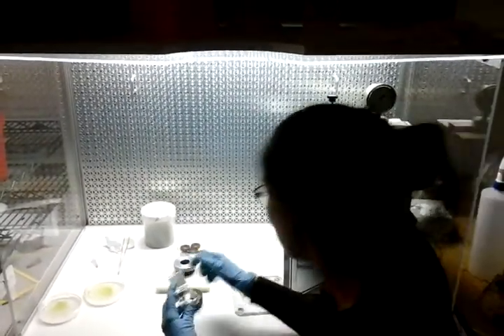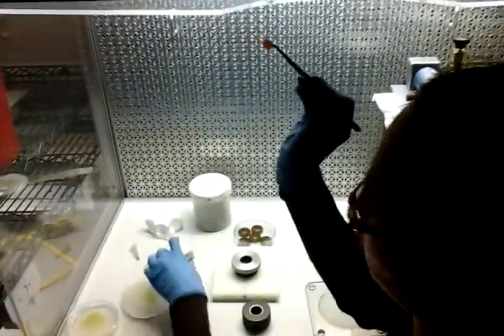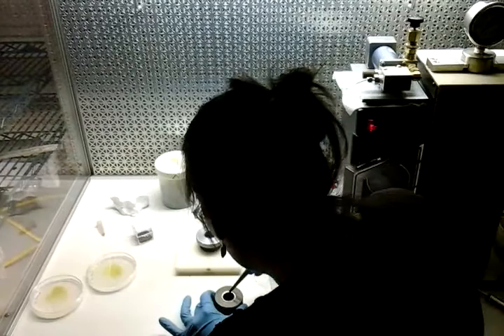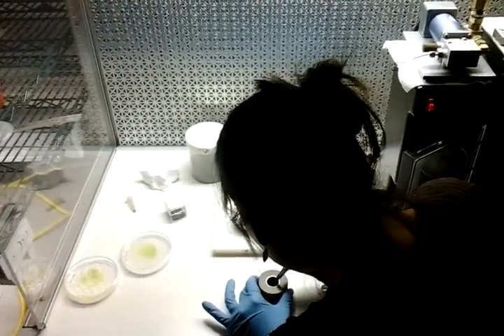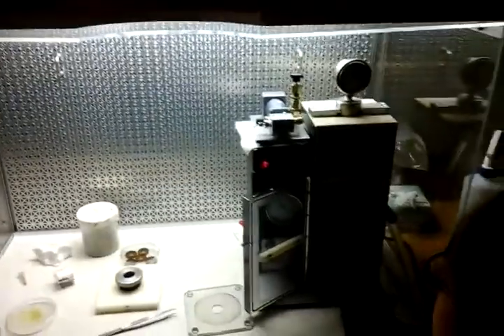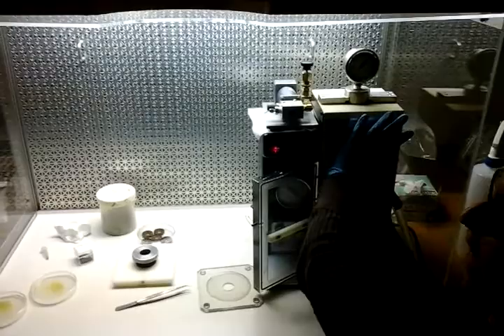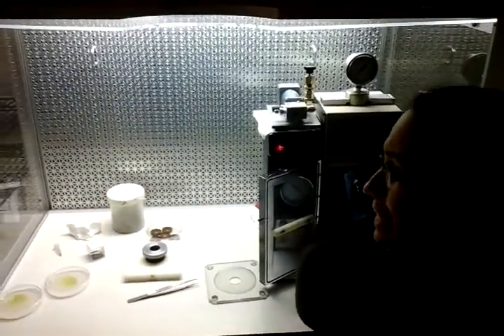I'm going to add one rupture disc. I'm going to add it here into my disc and screw it in. Pressure is going to build up back here, and we're going to have a lot of pressure, so I have to really make sure this is screwed in really tight.